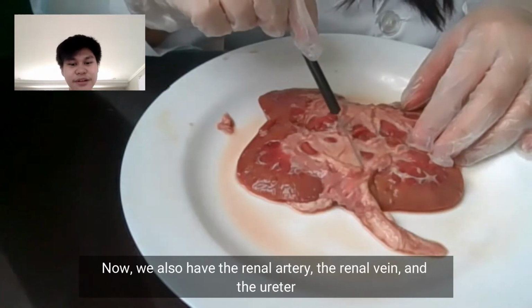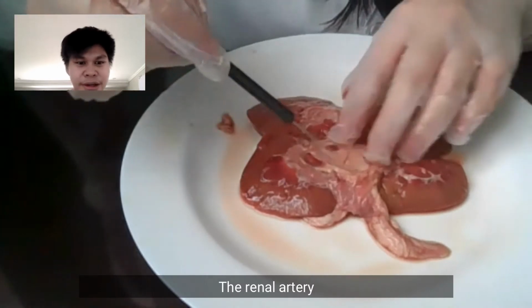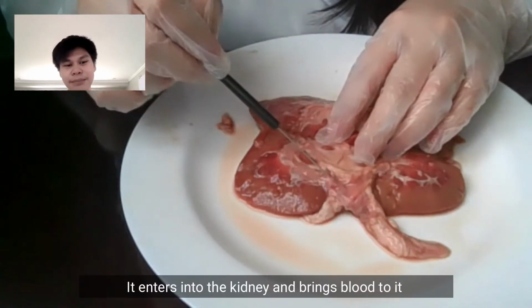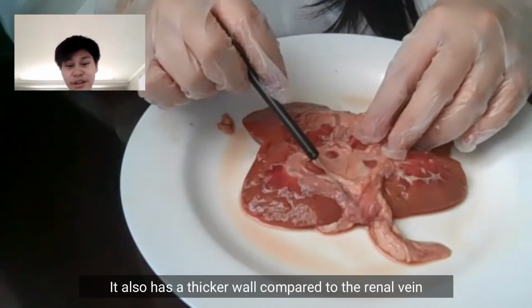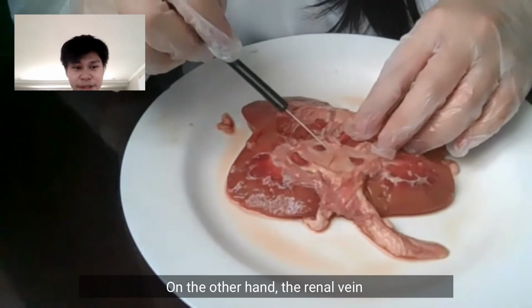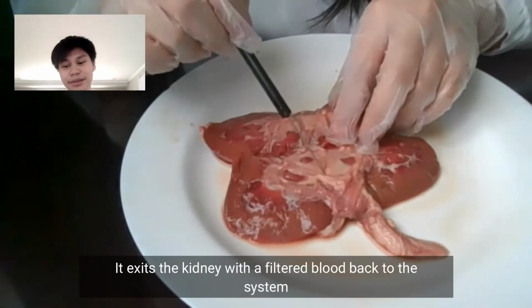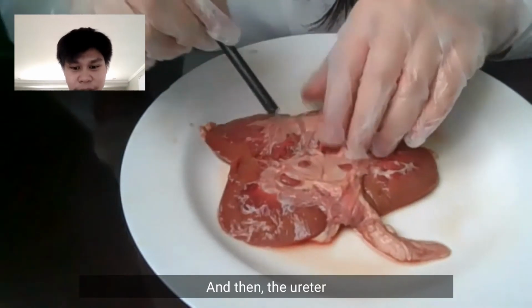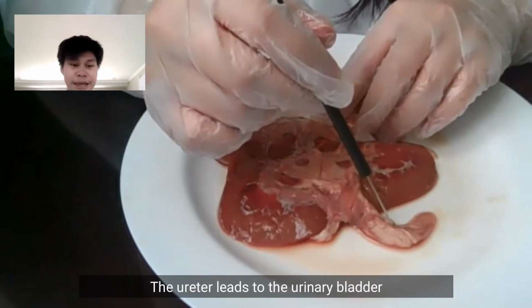Now we also have the renal artery, the renal vein, and the ureter. So the renal artery enters into the kidney and brings blood to it. It also has a thicker wall compared to the renal vein. On the other hand, the renal vein exits the kidney with the filtered blood back to the system. And then the ureter leads to the urinary bladder.